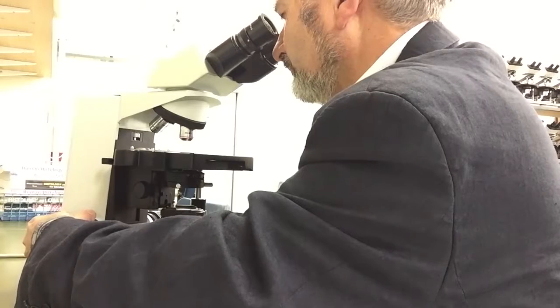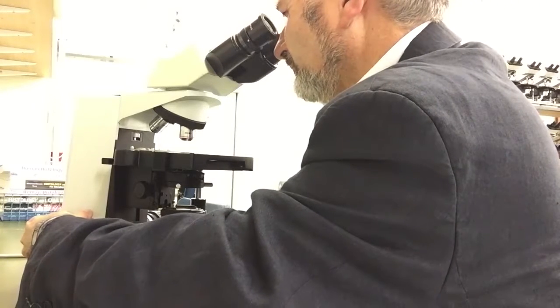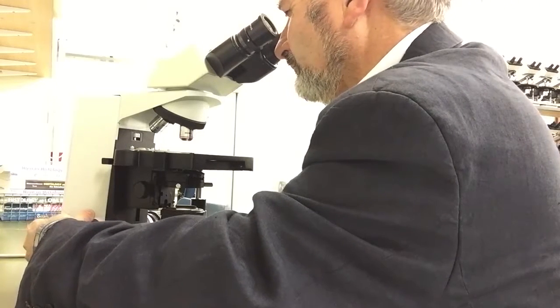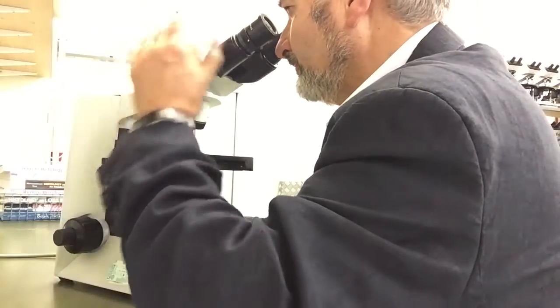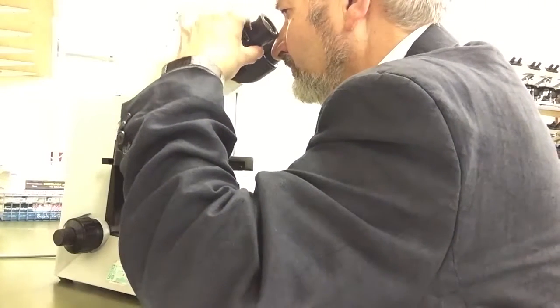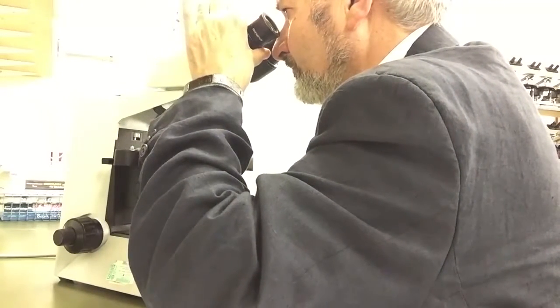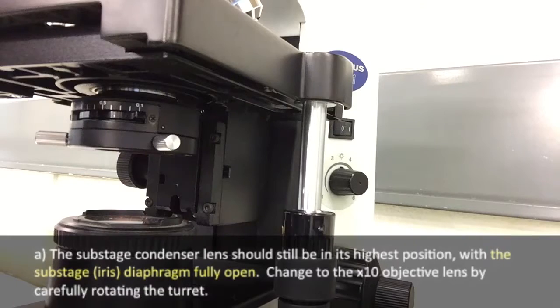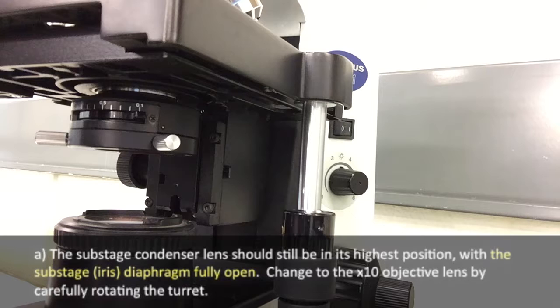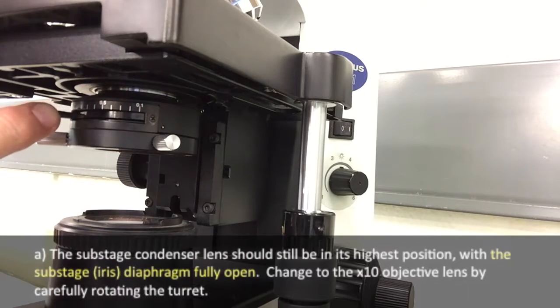To repeat: first through the fixed eyepiece, adjusting the focus at the base of the microscope, then through the adjustable eyepiece without touching the focus control at the base — just using the control on the eyepiece. Your specimen is now in focus. We can now switch to focusing the condenser, and first to do this we need to open the diaphragm on the condenser fully.